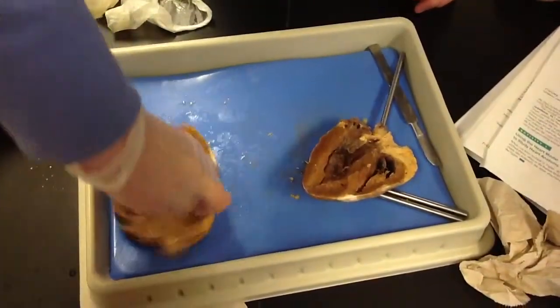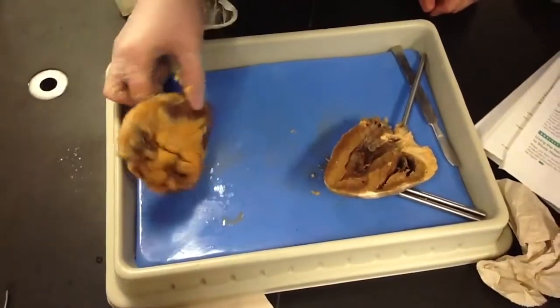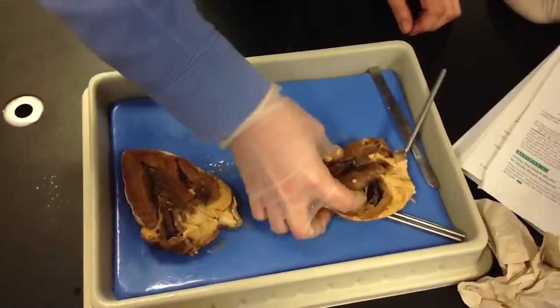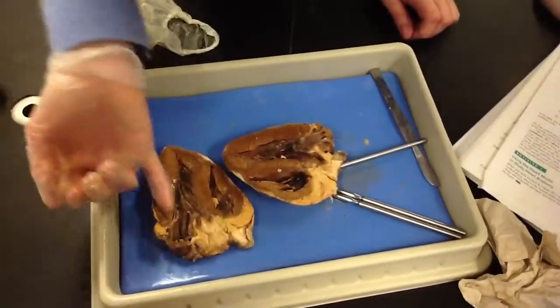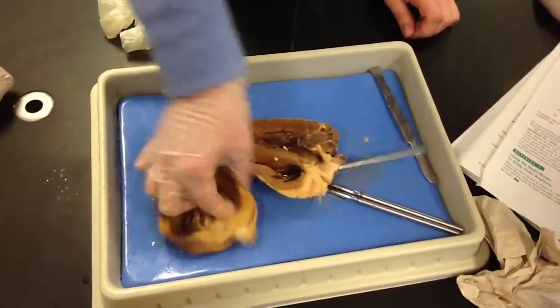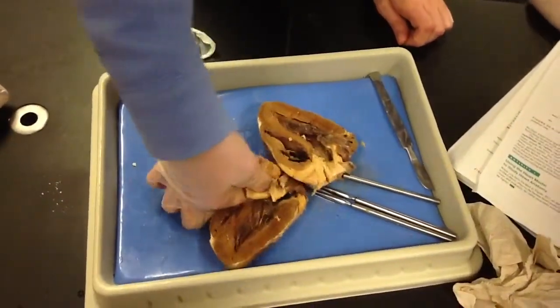Yeah, I didn't see it. I was just seeing how you guys cut it, that's all. Give me 1 second. I think you guys cut some stuff off. Really? Just because of how you cut it in half. Okay. Give me 1 second. No, there we go.